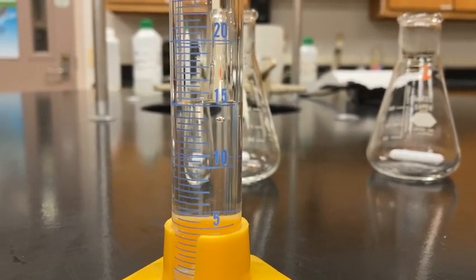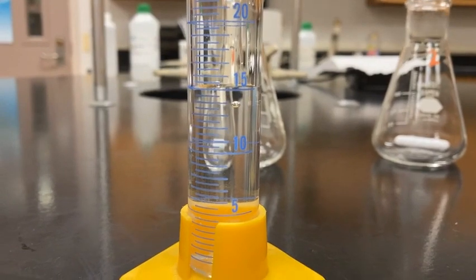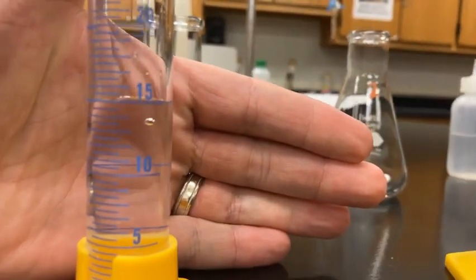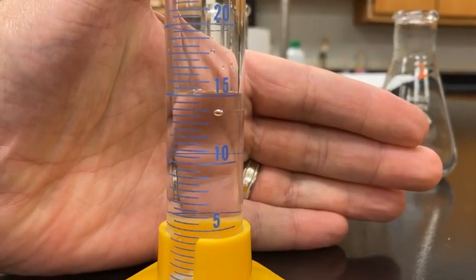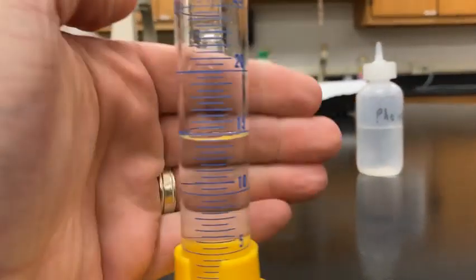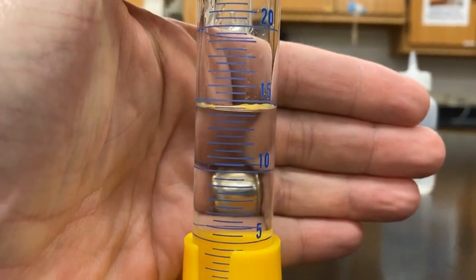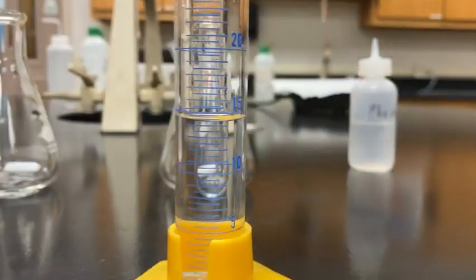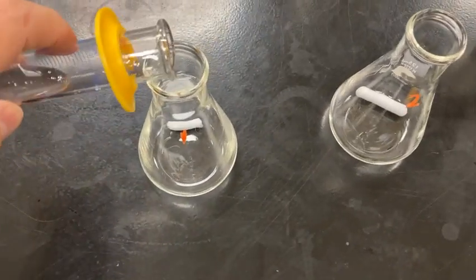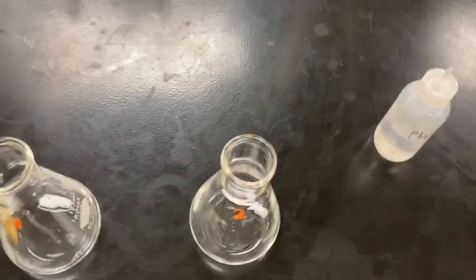So what I've done is I've filled 2 graduated cylinders side by side here with the potassium hydrogen tartrate solution. And I'll go ahead and put my hand behind here so you guys can get an accurate reading on this volume. Watch those increments, everybody. That's trial 1's data, and here's trial 2's data. Okay, let you get an accurate reading on that. And then I'm going to just pour trial 1's into flask 1 here. And I'm going to pour trial 2's into flask 2.